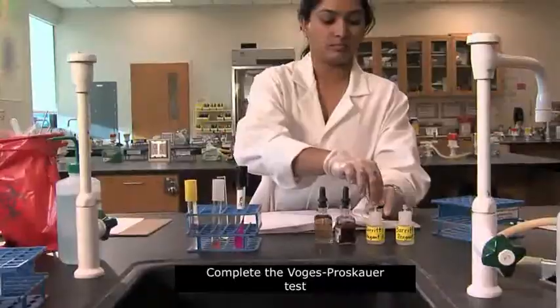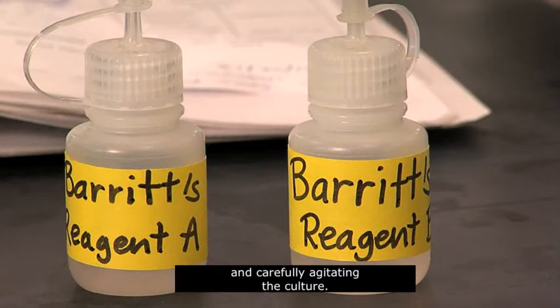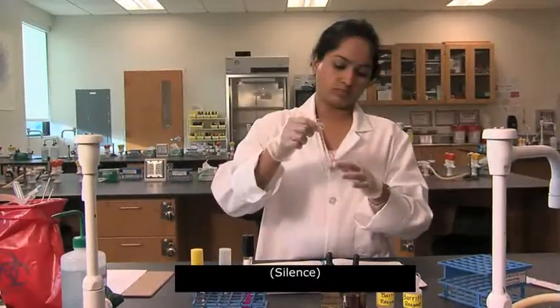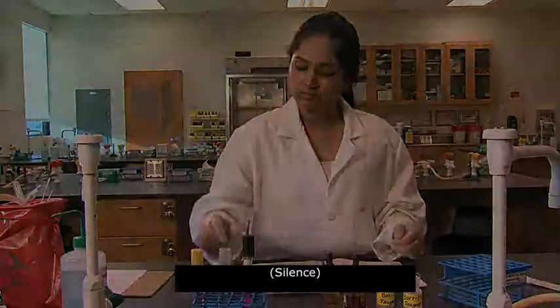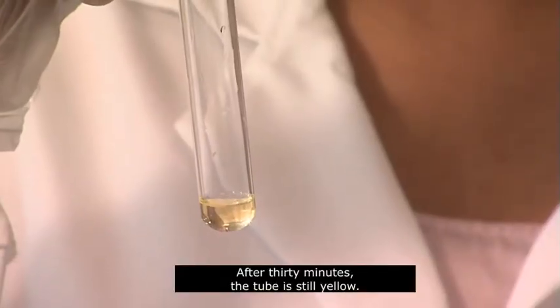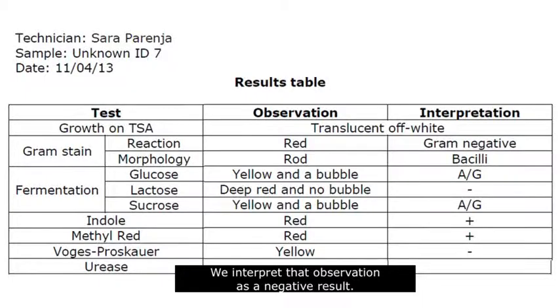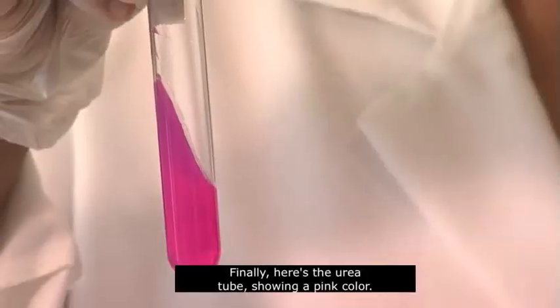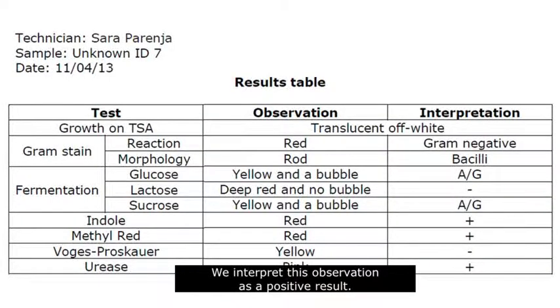Complete the Voges-Proskauer test by adding the appropriate Barritt's reagents and carefully agitating the culture. After 30 minutes, the tube is still yellow. We interpret that observation as a negative result. Finally, here's the urea tube, showing a pink color. We interpret this observation as a positive result.